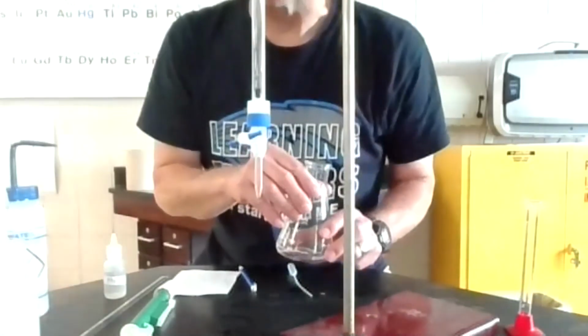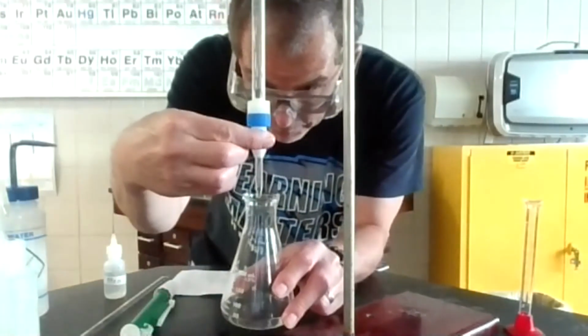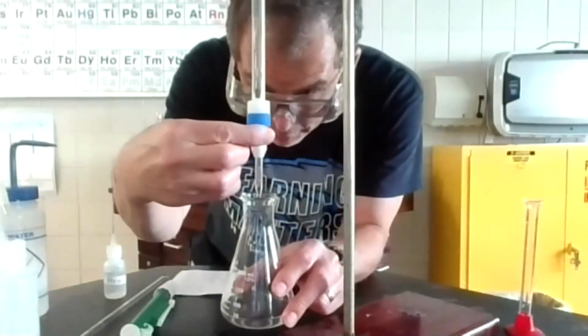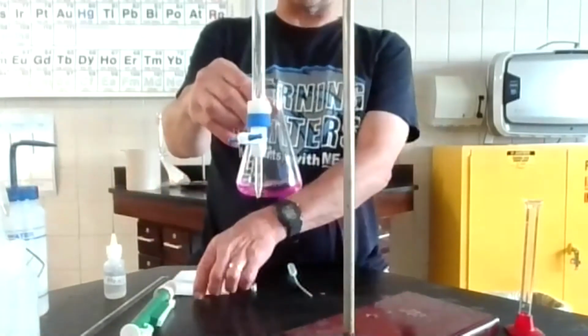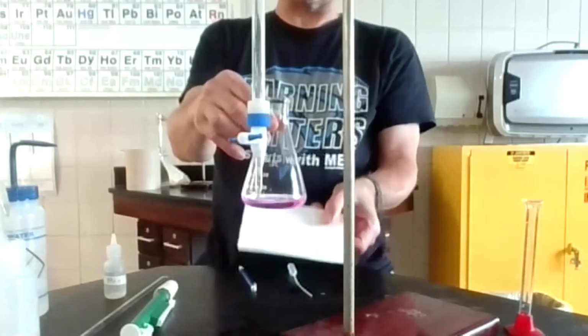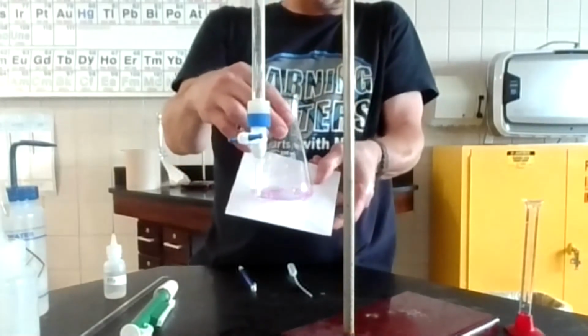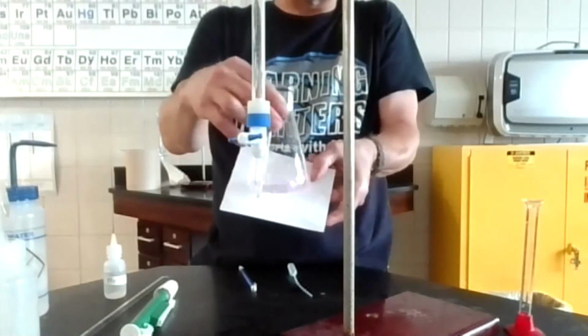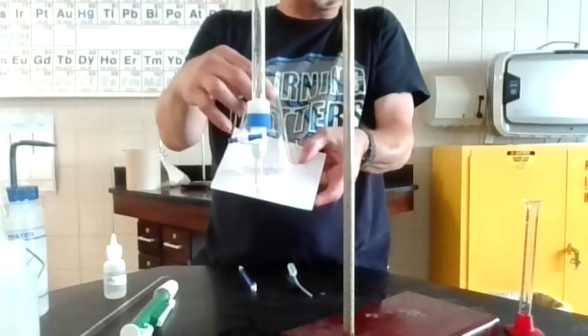And I think I'm 1 drop away. So I'm going to read this just to make sure what it is. And then I'm going to add this extra drop. And I add that. And notice that extra drop made it quite pink. It's staying. Is that sticking around for 15 seconds? I think I'm right at the end point, so I'm going to read that and use that. It's still faint pink after 10 or 15 seconds.